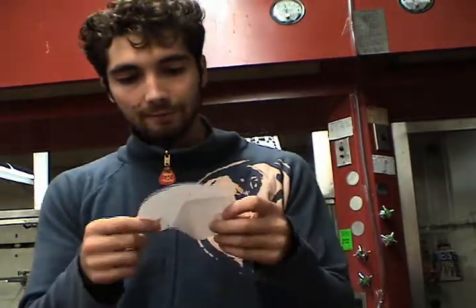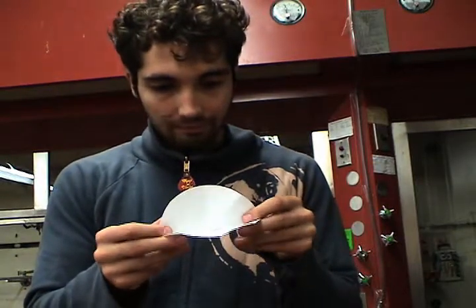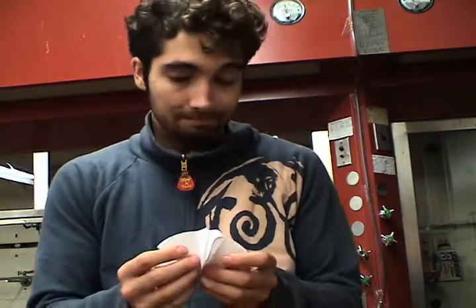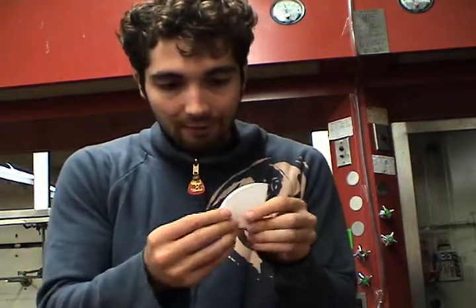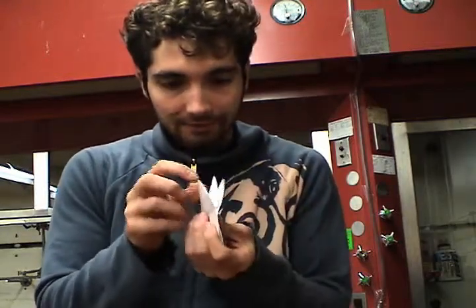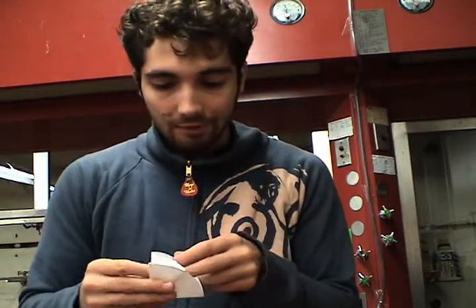It should end up with a pie-creased circle. Then take any two folds 180 degrees apart and pinch them, joining the point 45 degrees above and below each crease — like so. They're not touching. Push them in such that this puckers the other way. You get one of those fun little fortune teller guys that you used to make in elementary school — at least I did. Take two folds and push them in the direction of another one. Now you have three of those folds facing up and one facing down, or vice versa. This is the fortune teller — you folded them up. The only thing you have to do is open up that center fold, and there you go. You have fluted the filter paper.